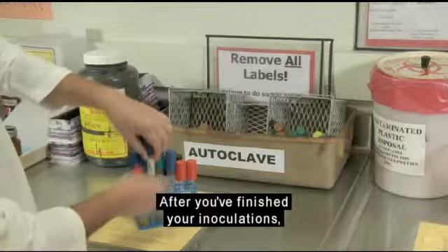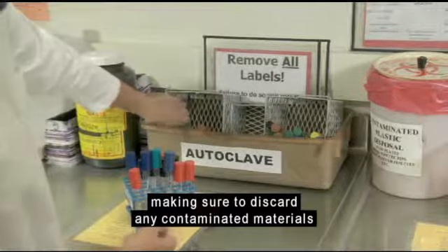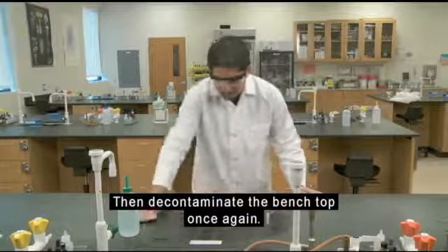After you've finished your inoculations, remove all materials from the benchtop, making sure to discard any contaminated materials in the appropriate waste container. Then decontaminate the benchtop once again.